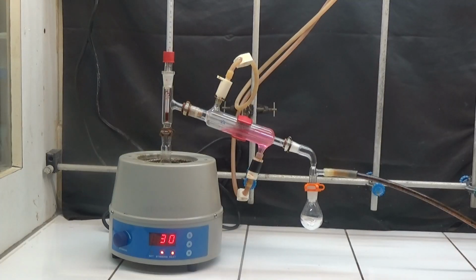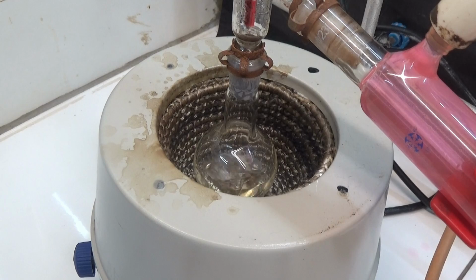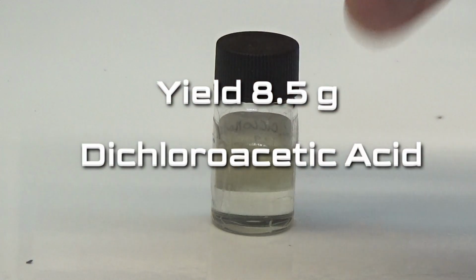To purify dichloroacetic acid, it is distilled under reduced pressure. The acid undergoes decomposition if distilled at normal pressure. The distillation is maintained at a temperature of 100 to 110 degrees and a pressure of 50 to 60 mm. In this operation about 8.5 grams of dichloroacetic acid have been obtained.